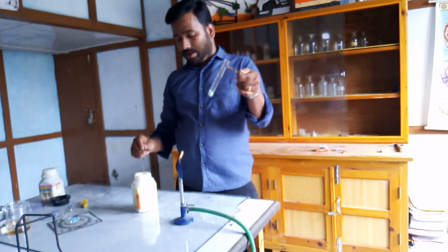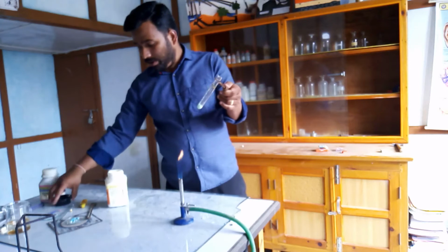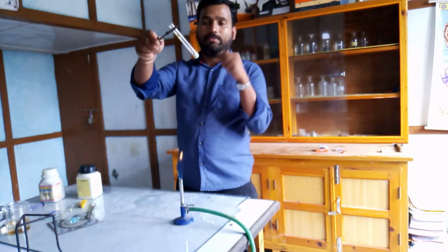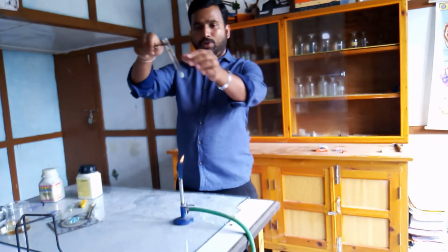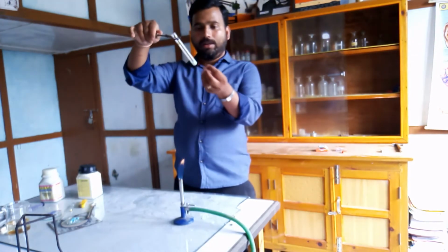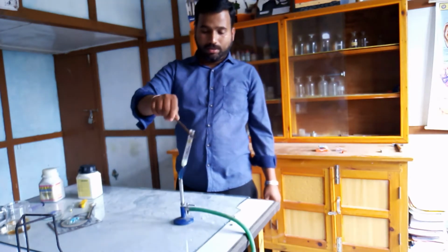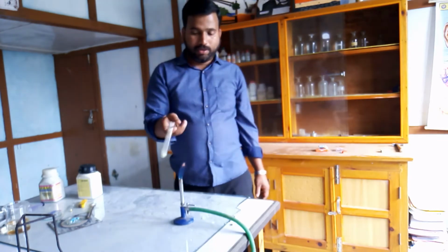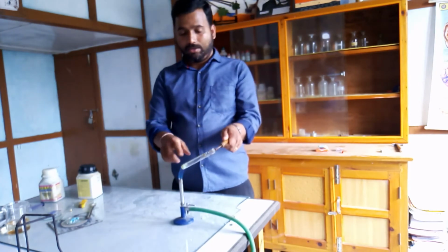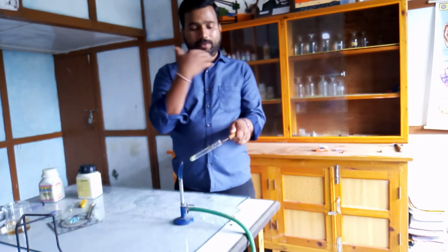Here ferrous sulfate, FeSO4, ferrous sulfate crystals, are green in color. So what will happen when you heat this? The best observation that you need to notice here is the color change. In the previous video we have seen that the blue color of copper sulfate was changed as a result of heating. So here also you can see the color change. Also remember that while you heat the test tube using a Bunsen burner, you need to keep the mouth of the test tube facing away from your face.